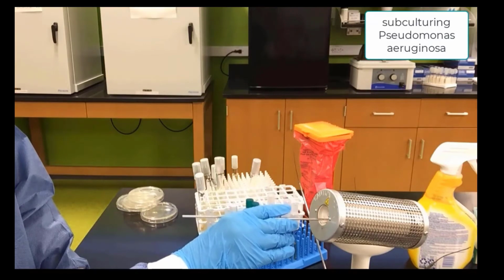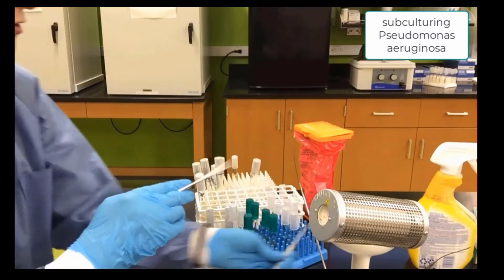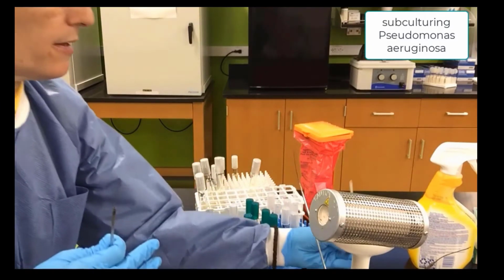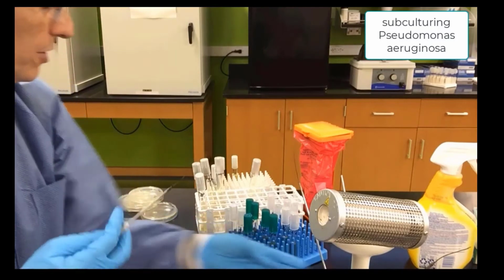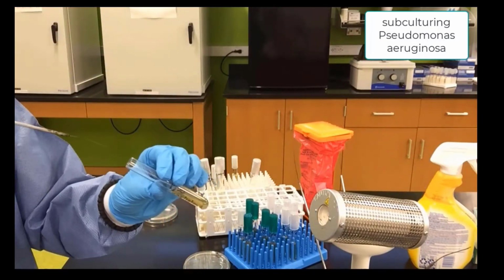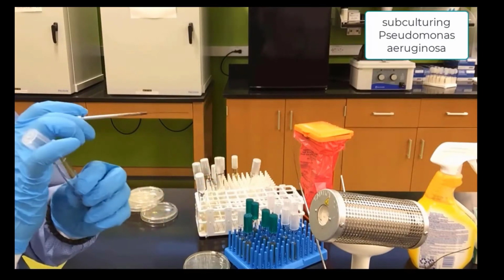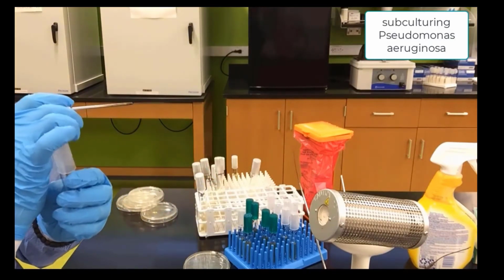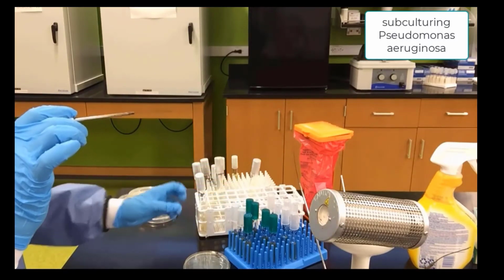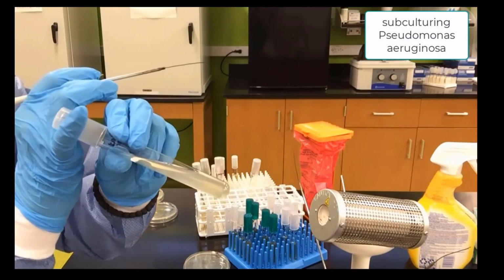We sterilize our needle. We pick up another cool needle. And now we will go into the Pseudomonas aeruginosa original culture again with a cool loop needle. And we will now inoculate, subculture, the Pseudomonas into this agar slant.